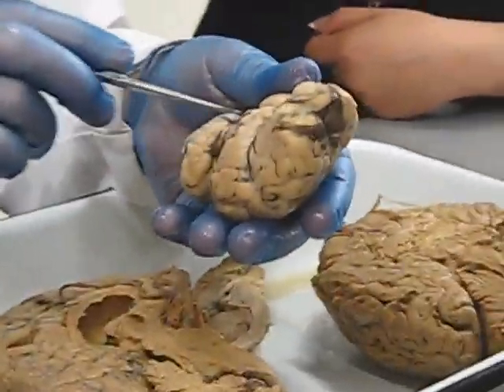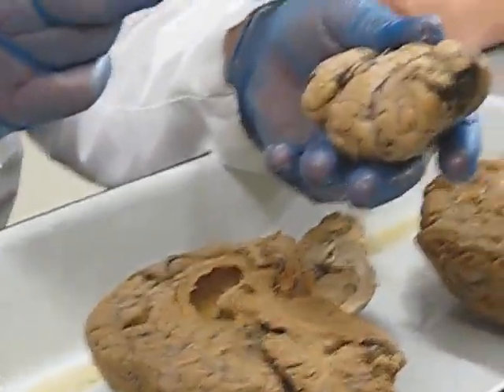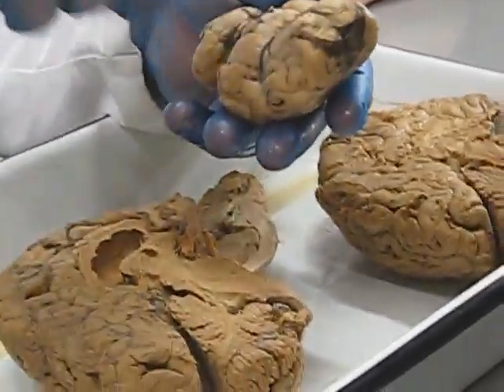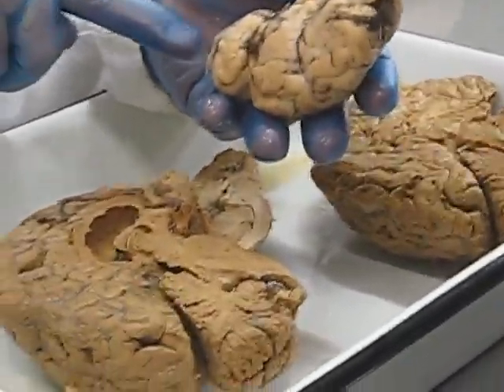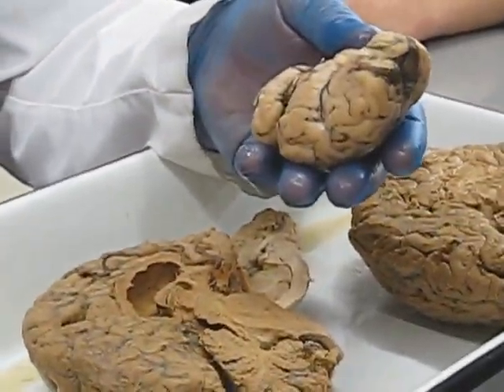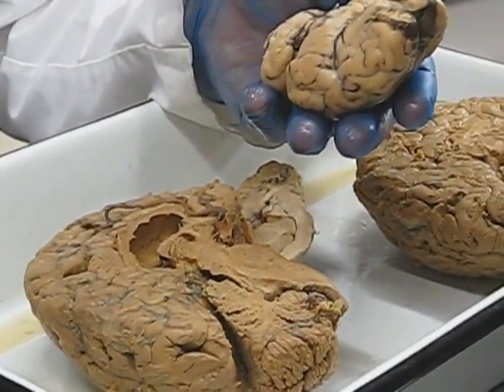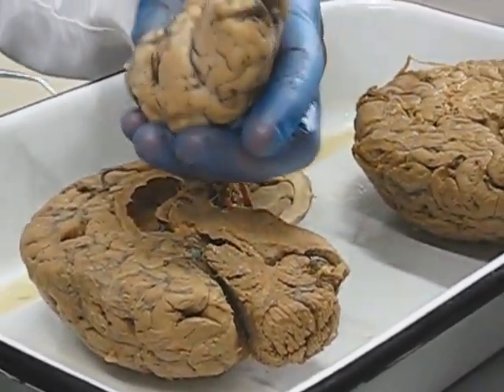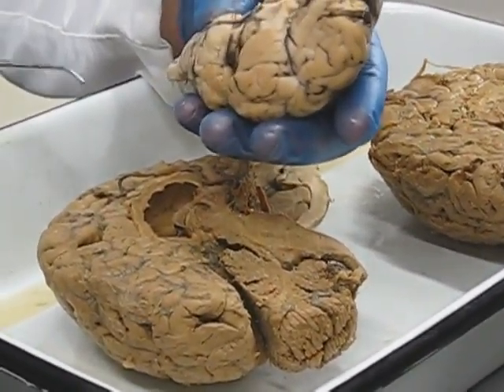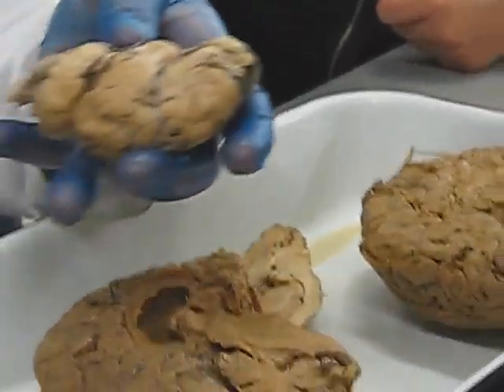These things right here, cerebral peduncles. What they are is nerve tracts. They're bundles of myelinated axons running back and forth from the brainstem into the brain, or from the brain through the brainstem and out into the medulla and to the spinal cord and on. So is part of that brain gone, or you just can't see? No, it's all there. In a human brain, it's kind of all tucked together like that.